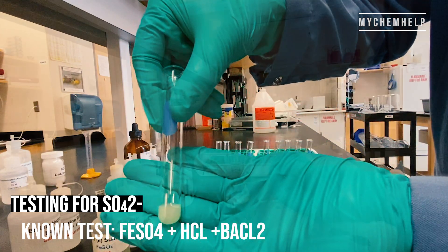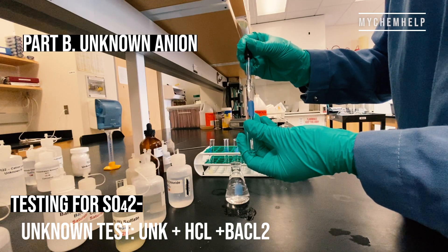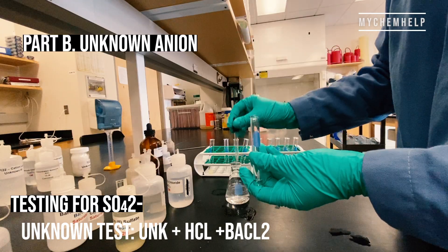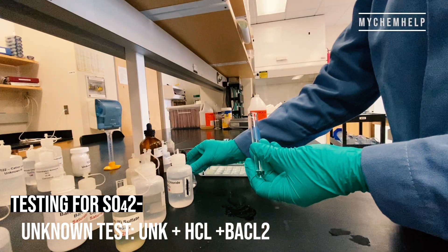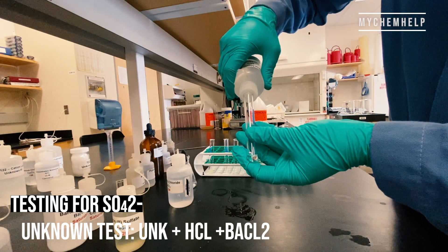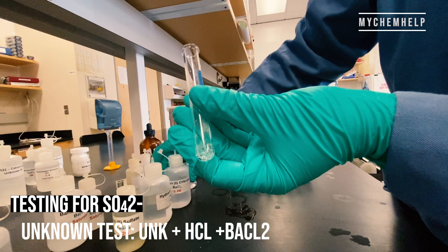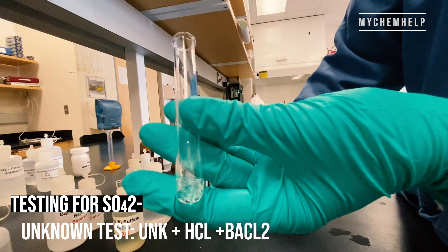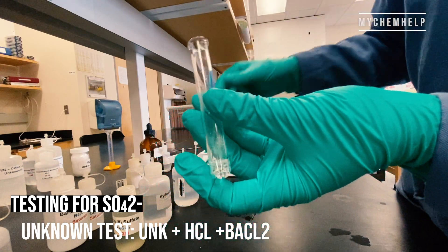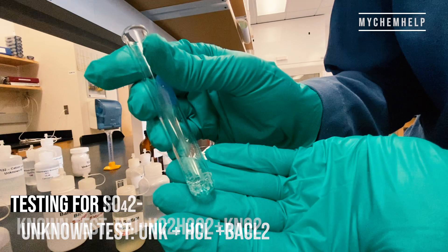Now let's check out the unknown for sulfate. I've got my unknown solution, dropping a bit into the test tube, adding some hydrochloric acid. It looks like some bubbles formed. And here's the barium chloride being added.